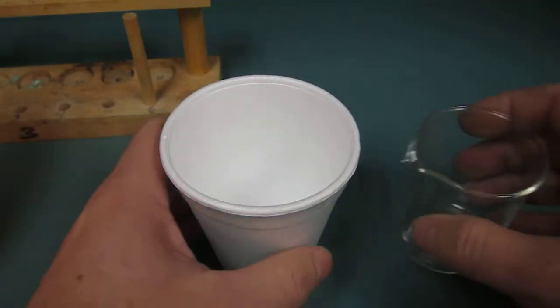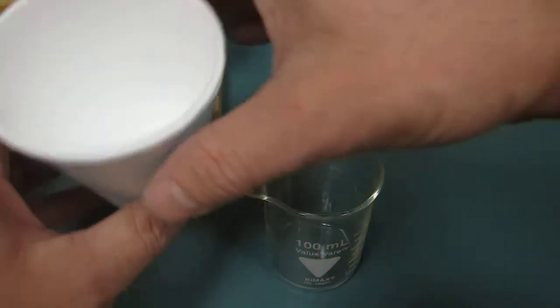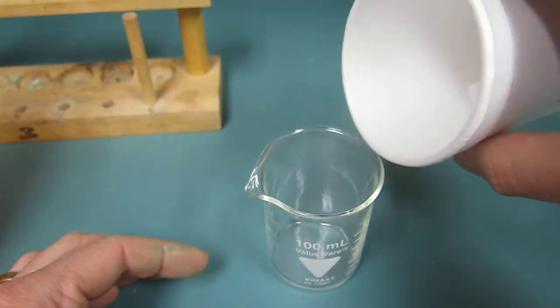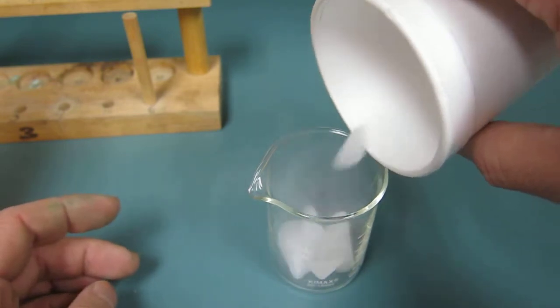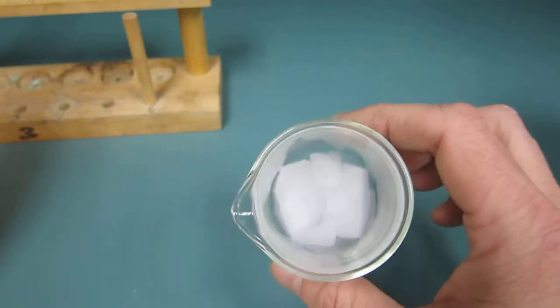Okay, I got some dry ice here and you have a lab to do. It says to put it in a styrofoam cup if I remember the lab handout right, but you can't see it in there from the video. So I'm going to put it in a beaker and you can make the best observations you can from the video.